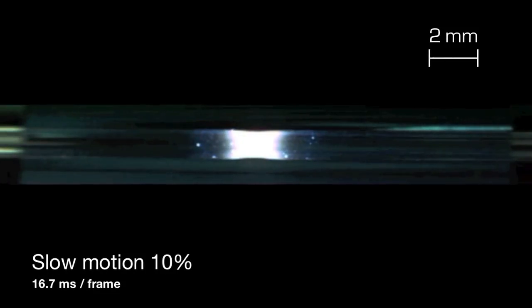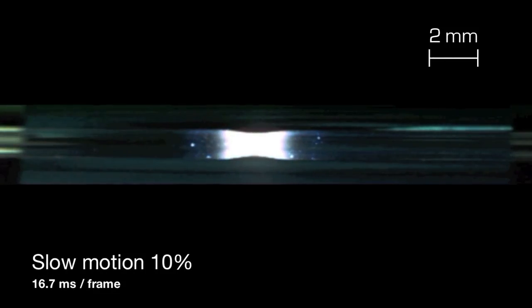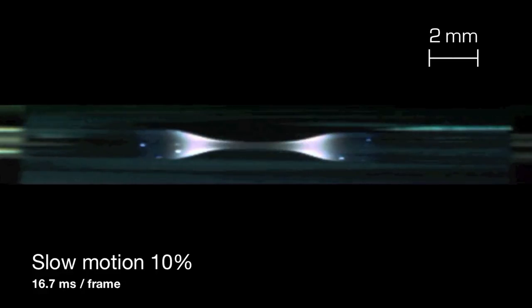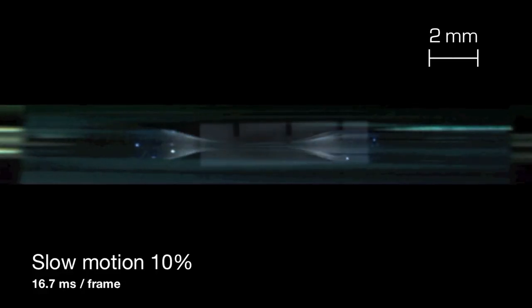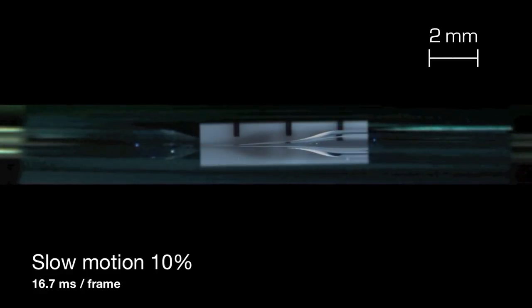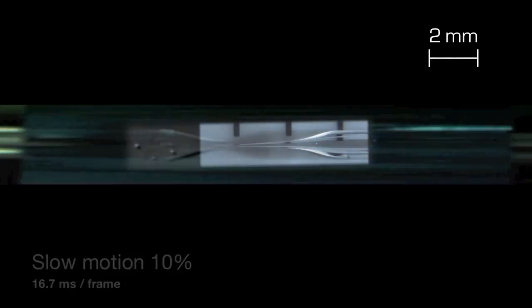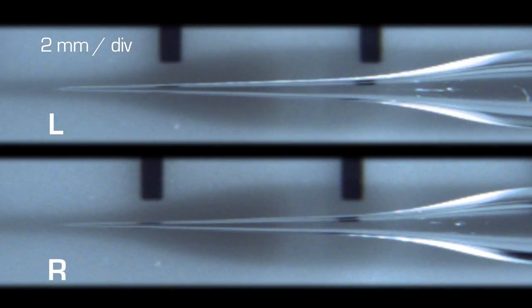Now let's take a look at the right side and see whether the pull has produced symmetrical pipettes. Again, the image of the final pipette is superimposed and aligned on the video. The tip protrudes about 1mm to the left of the center just as the other side did, and the pipette is virtually a mirror image of the left half.